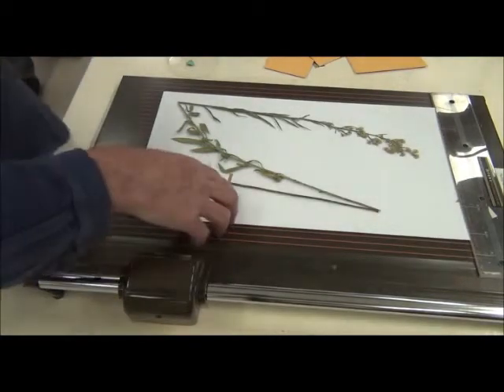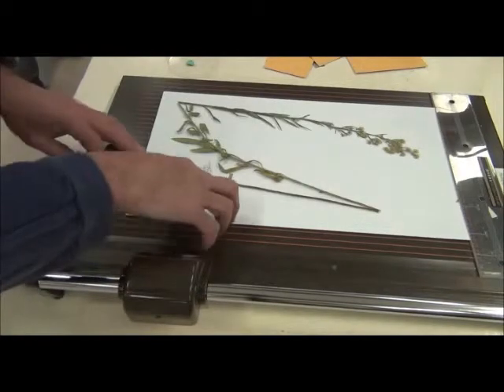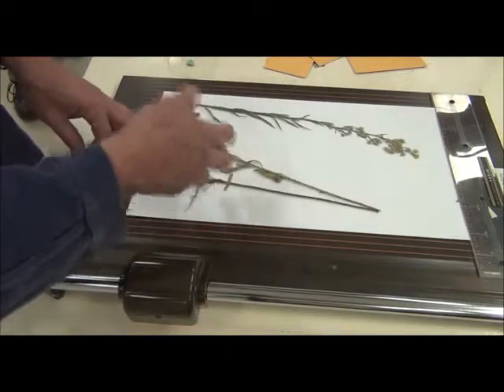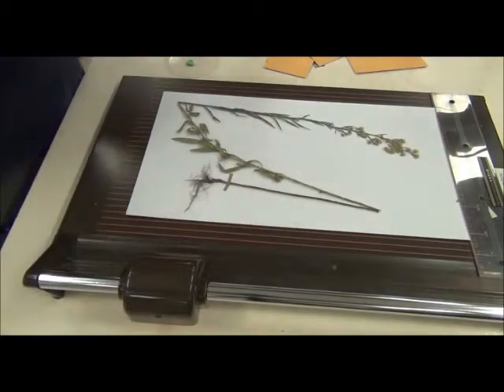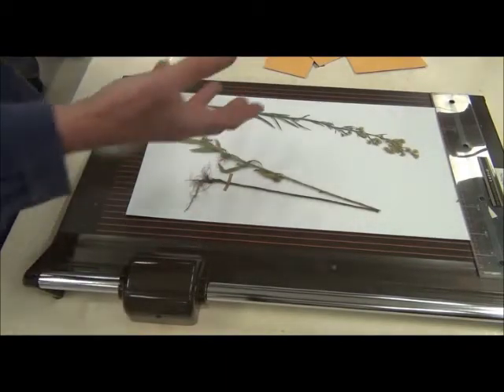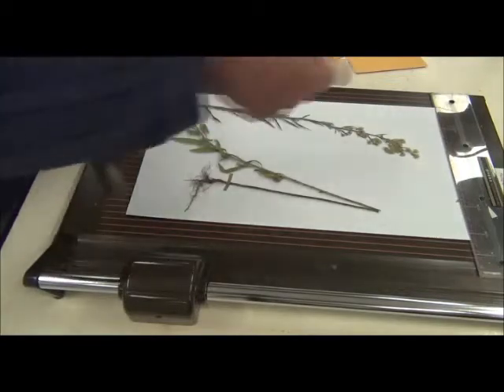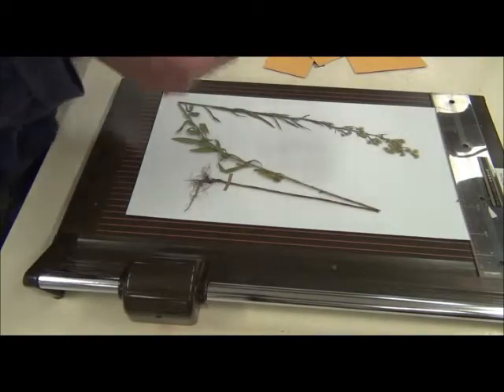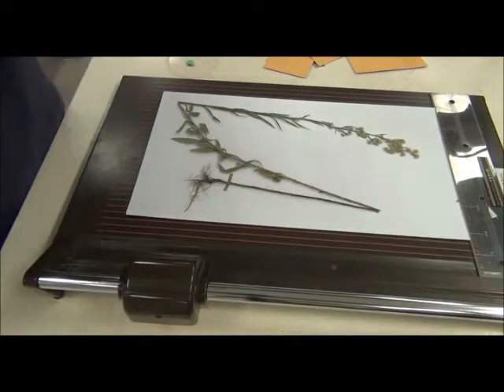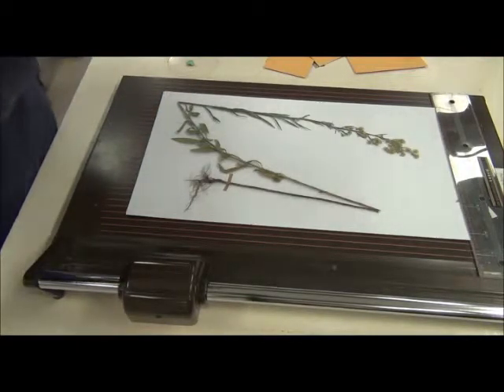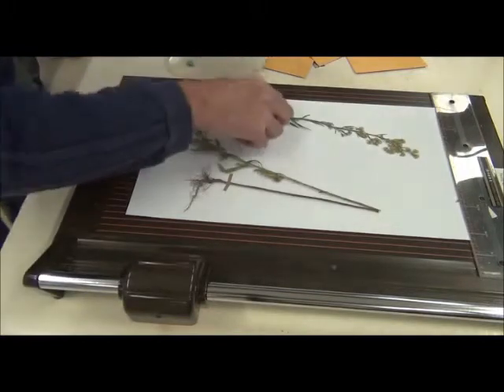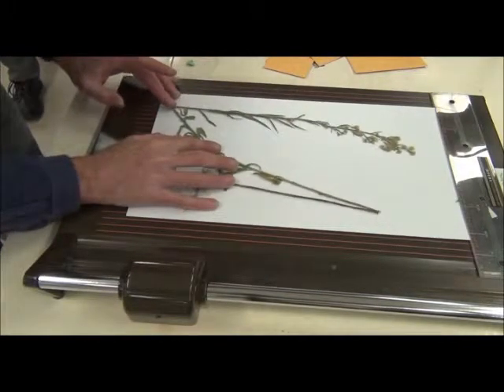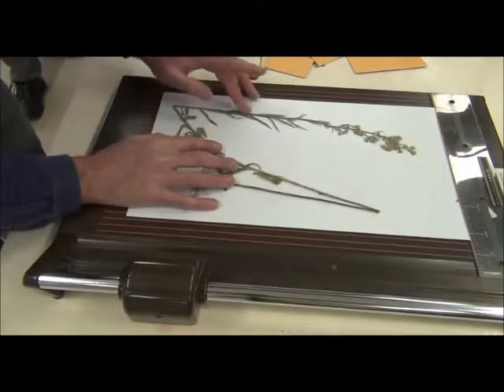The beauty of this is if you make a real mess of it, you can actually cut and remove that and redo it and have a second go. And that's the other thing, if we at some later stage want to remount this, we can just go snip, snip, snip and off it comes. So now for some of the smaller bits. A bit of the morning tea. Okay, so here I can use this to hold it in place.